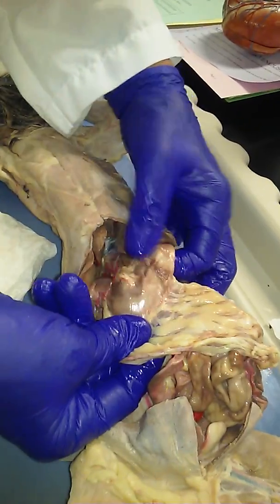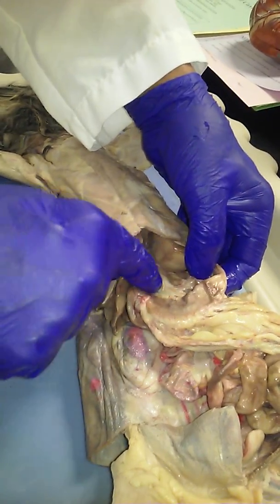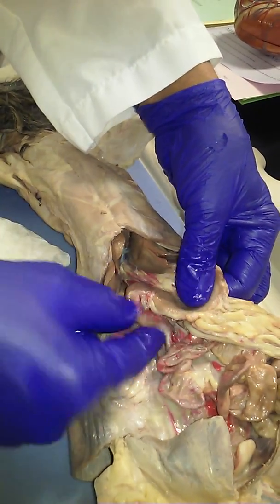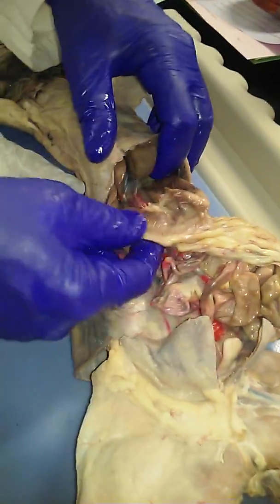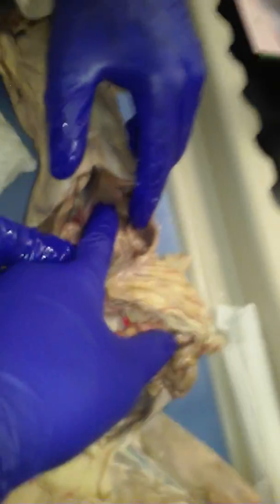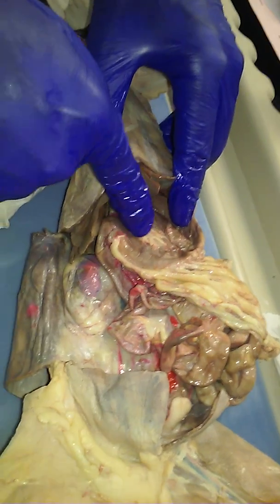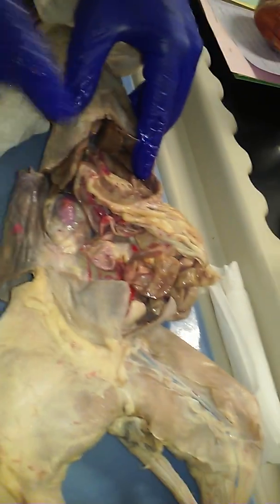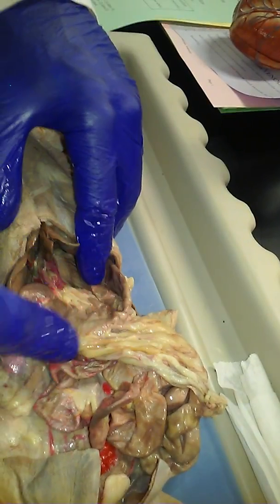So here's the fundus, right? Here's the pylorus over here. Here's where it's curving around this fat in here, right? And here's where the pyloric sphincter is, and here's where the small intestine starts. Oh, and this is the U that you were talking about right here. See this fat right here? The U goes right around there. See the inside U where it says LC? That LC, that's right here. That's the lesser curvature of the stomach right in there. This is the greater curvature out here. Okay. Got it.